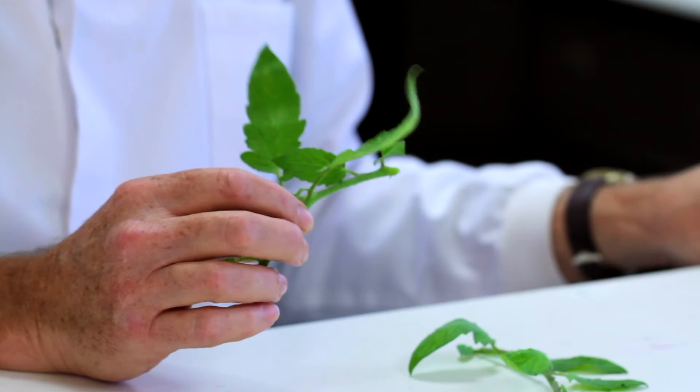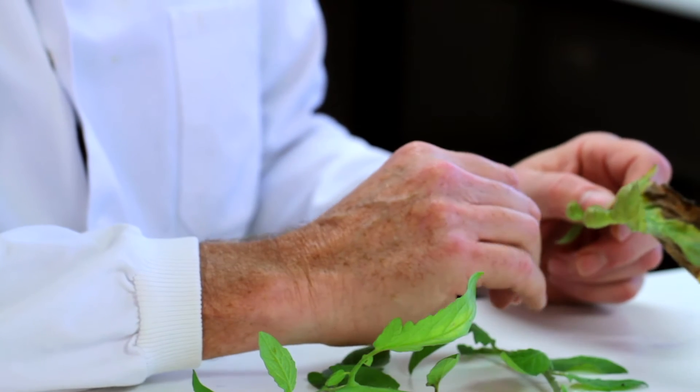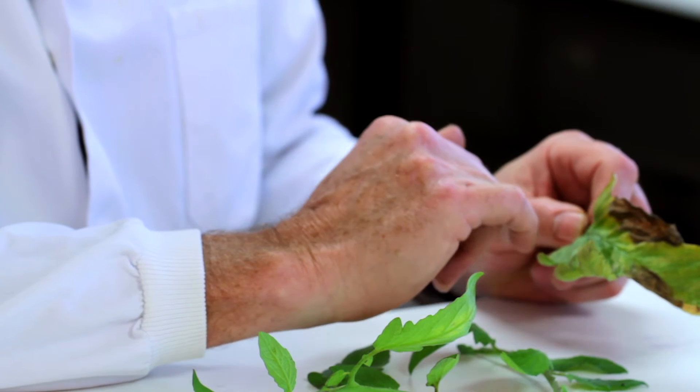The surface of even a healthy plant is covered with fungi and bacteria, and the numbers are far greater on a diseased plant. On a diseased area of a plant, almost all the microbes will be opportunists, feasting on the nutrients released from the dead or dying plant tissue. Pathogens generally do not compete well with the opportunists and will die and be outcompeted by fungi and bacteria more suited to growing quickly in the relatively rich nutrient environment. The pathogen is normally located near the site of symptoms, but wilt-inducing pathogens are an obvious exception — the wilt is seen in the upper leaves but the pathogen will be infecting at the base of the plant.